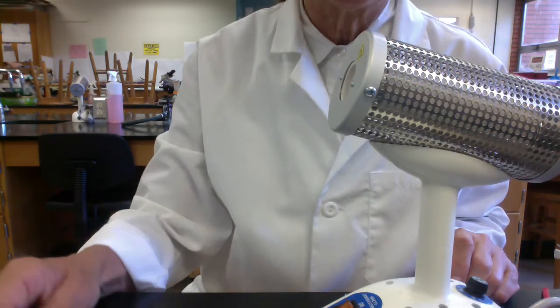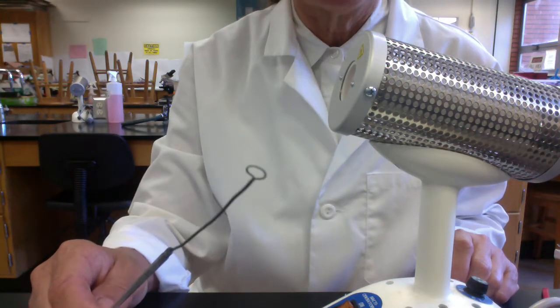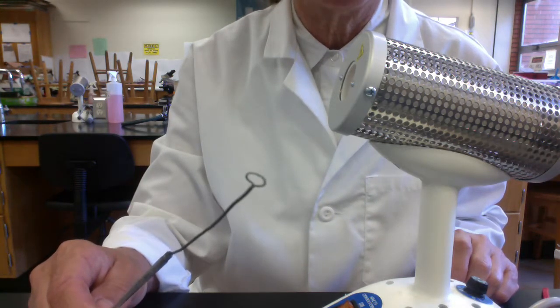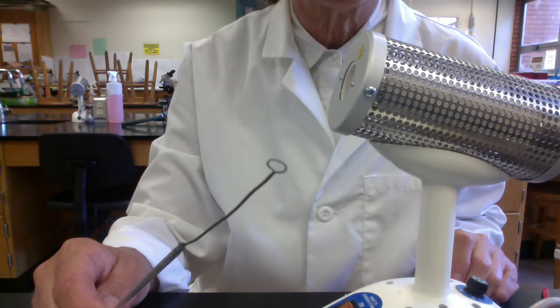But as you can imagine, these inoculating instruments are contaminated. They're covered in unwanted microbes. So when we're doing transfers, we need to sterilize our loop in this case.